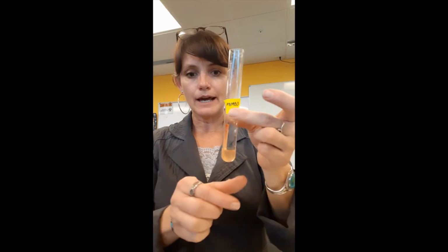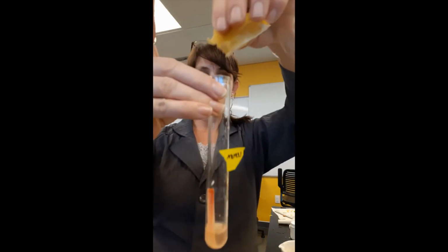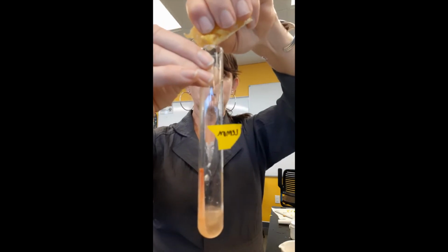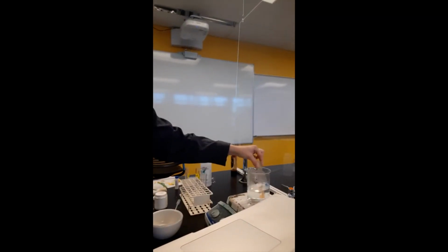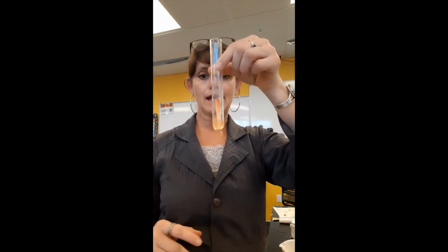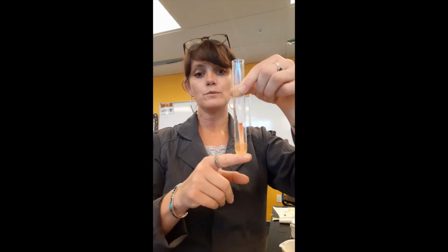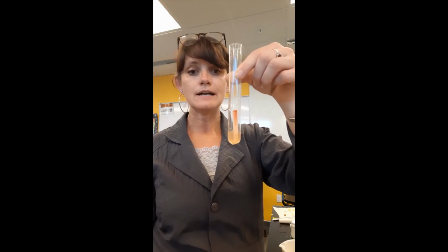Now we're going to use lemon as our control, and so I've placed only lemon juice in here. Add just a little bit more, just to replicate the process so you can see it. And the calcium oxide. And so this control shows that we have no color change when we're in the presence of an acid. So even though I put that calcium oxide, which is a base intended to break apart food particles that contain proteins by breaking apart the proteins into their amino acids, this is our control.